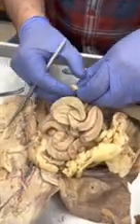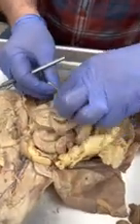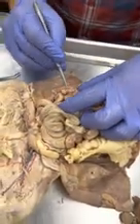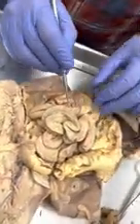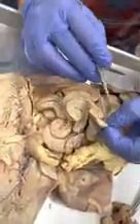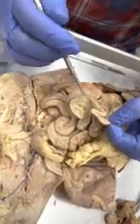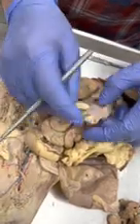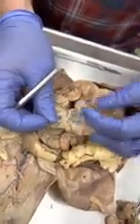I'm going to take off a lymph node, just so we can see this a little better. So you can see right there is the ileum. Okay, here's the large intestine. If I put a sticker somewhere here in the middle of the small intestine, it would be the jejunum. Okay, that's the mesentery. All right, so that's the mesentery.